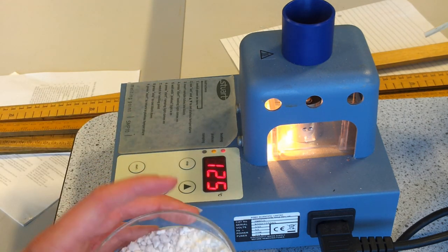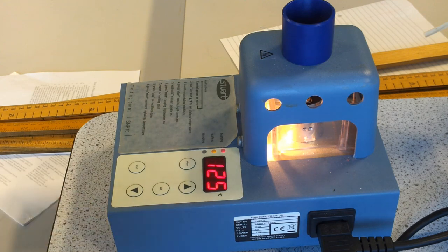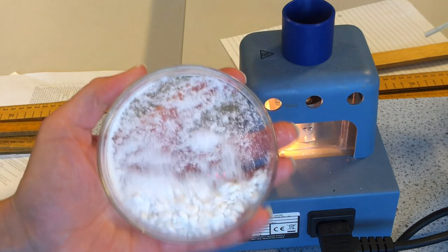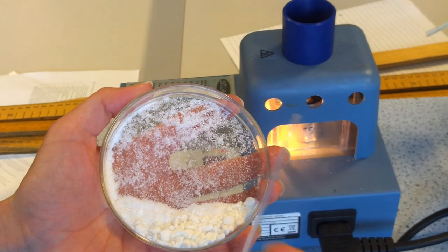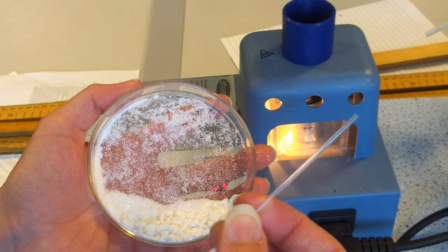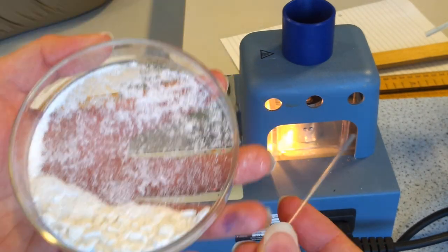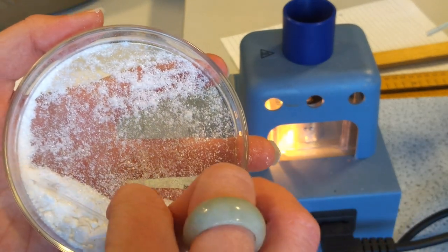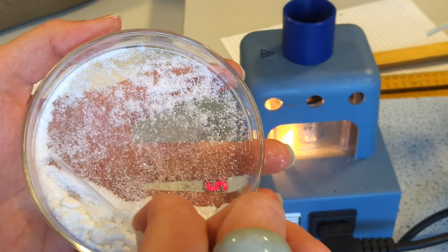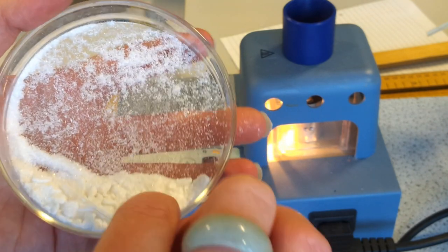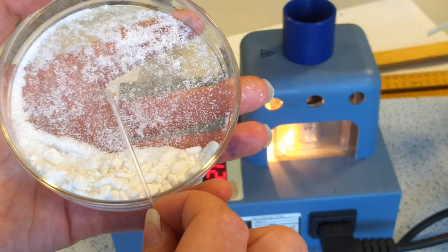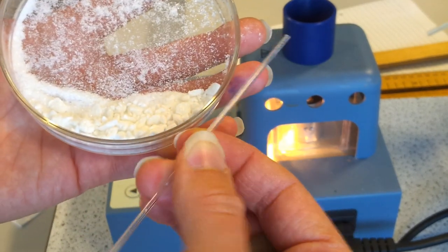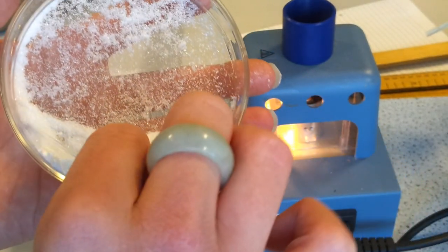We now need to collect some of the aspirin that we have made, so here is that aspirin. This is a capillary tube, a very small tube with a hole through the middle, and at the bottom it's closed, so we're going to collect some up, and if you tap it will gradually get to the bottom.